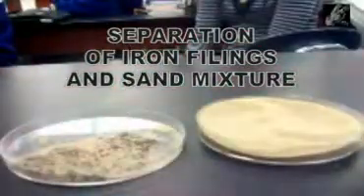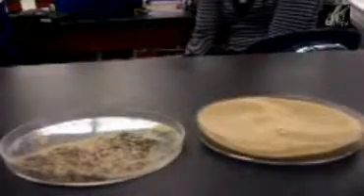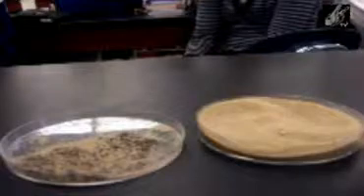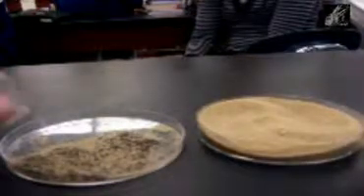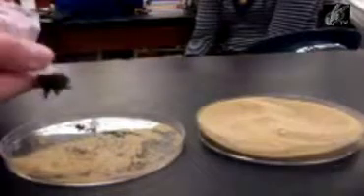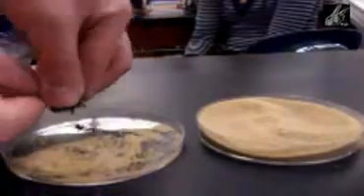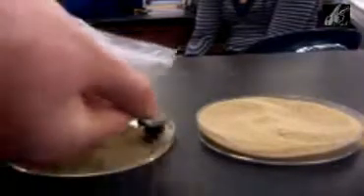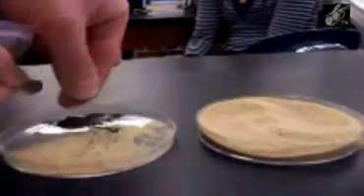Now certainly at this point there is some sand still mixed in with the iron, but we could go through a refining process where we repeat the process, trying each time to get less and less sand caught up with our iron bits, and eventually we could get to the point where we had just iron in its own pile and our sand left on its own.